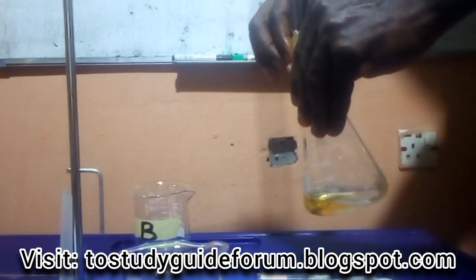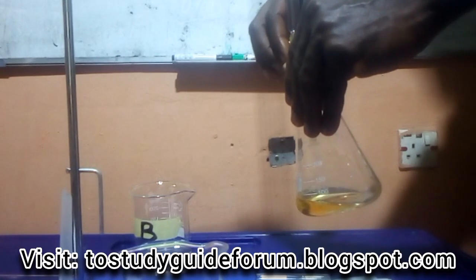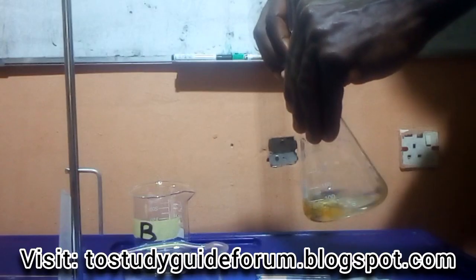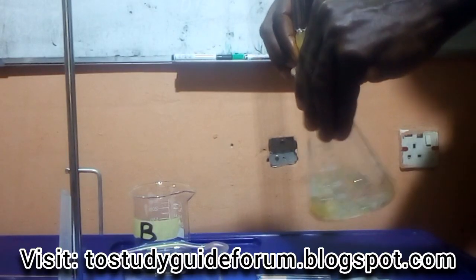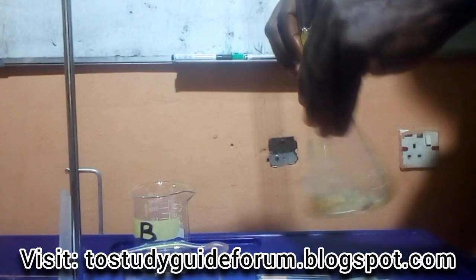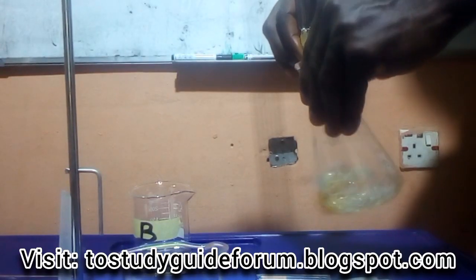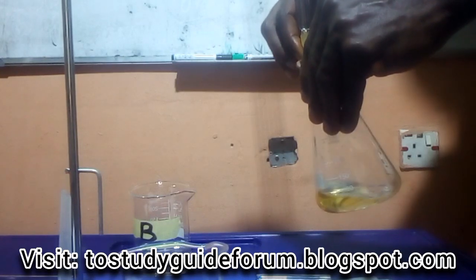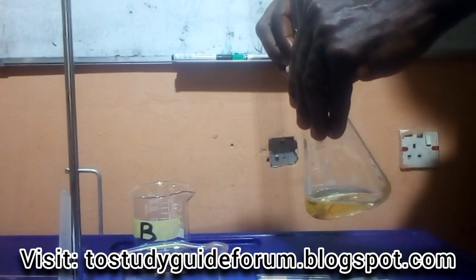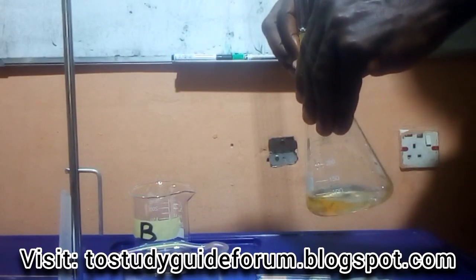Now my burette here is where the last one is stored, because since I have 12.1, meaning that I can still get another 12.1 or more from here. There's no need starting from the beginning, starting from 0 again. That's the thing now. Now at this point where the color is coming and disappearing is when you have to be very, very careful in your titration, so that you'll be able to get this endpoint. The color is coming and disappearing.